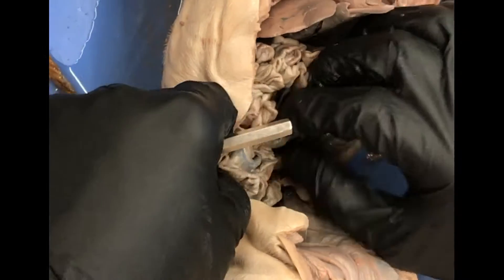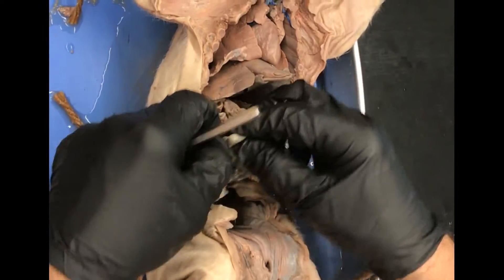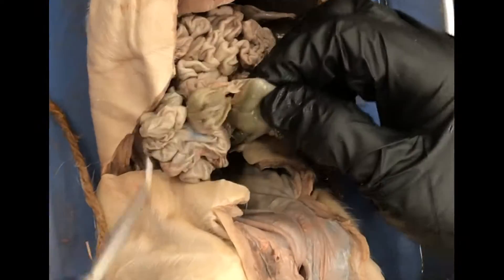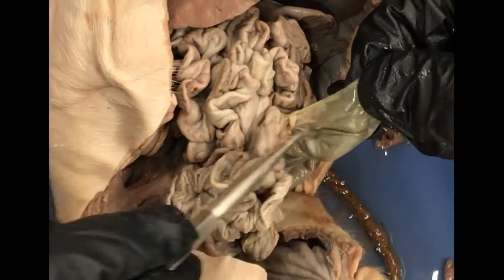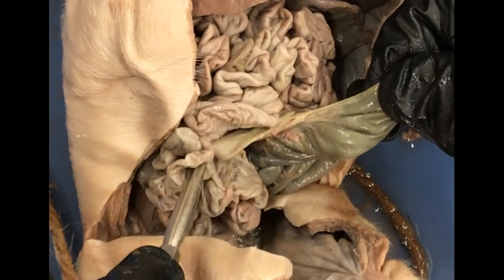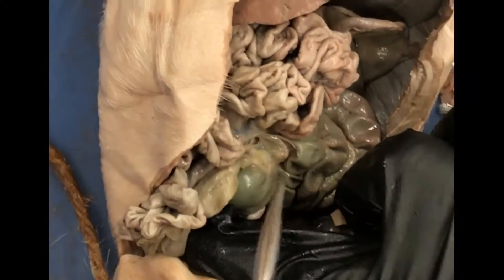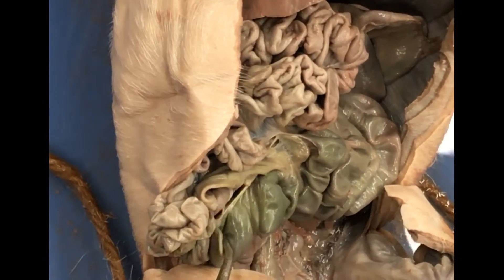Now you should also be able to see a piece coming off of the cecum. Actually, what we were looking at before wasn't the cecum — it was the appendix; it's just big. So this is the appendix, it's a little bigger here. And then the cecum is the part that the ileum goes right into — cecum, appendix.